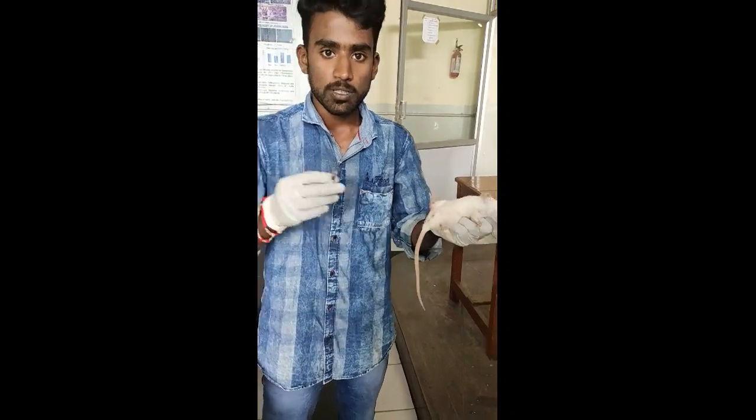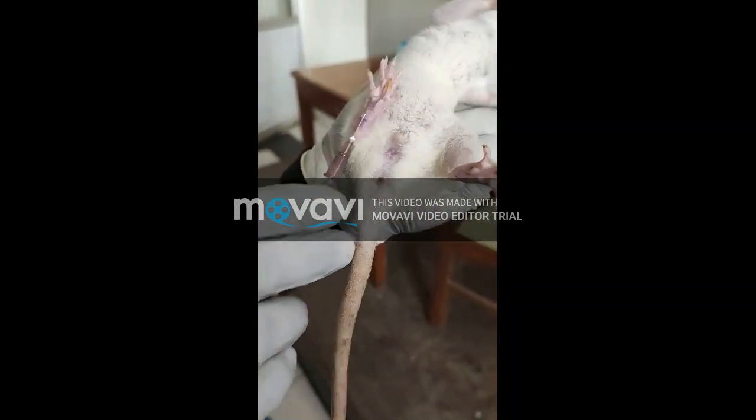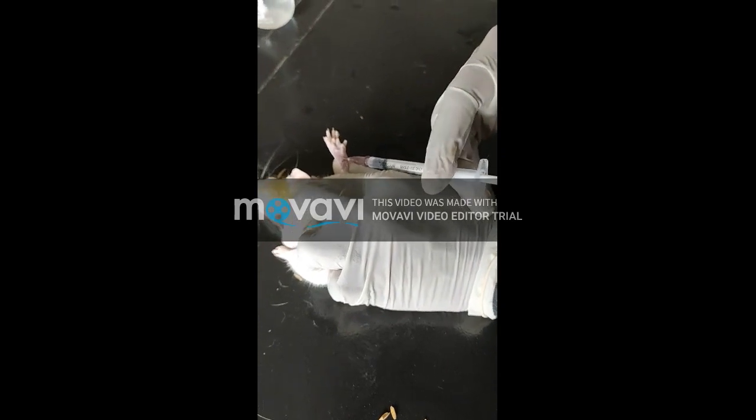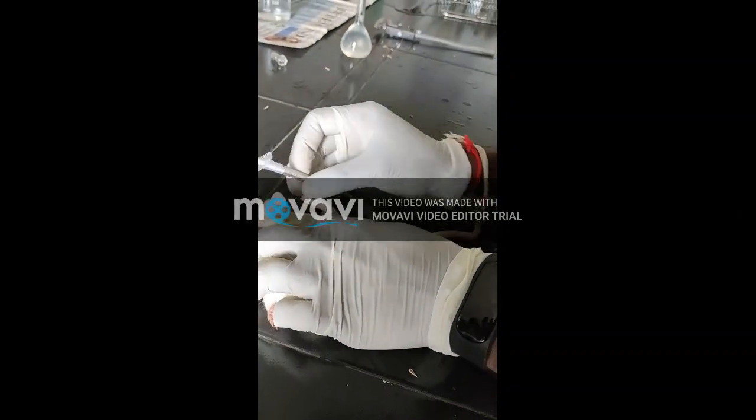After 1 hour, I am injecting carrageenan paw edema by subplantar route. This is the subplantar injection site. I am injecting 0.1 ml carrageenan by subplantar route. Leave it for 1 hour after injection.